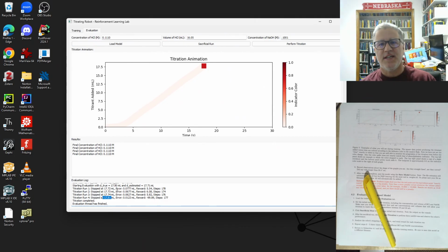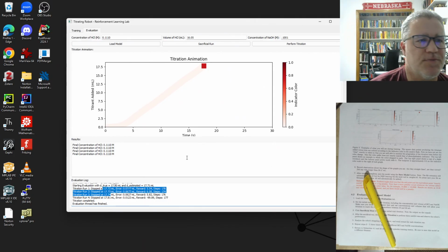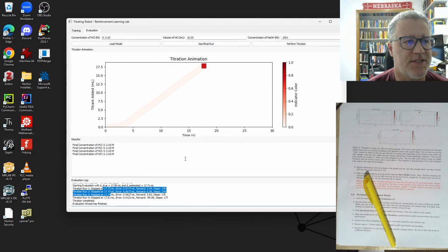And so you can see that this robot has been trained, but because this is somewhat of a new scenario for it, it's not absolute. So even when it's trained, it can go past, as we've seen here. But when we look at these, we get very consistent results. And so this is a good example of how this has been trained, but it still can make mistakes.